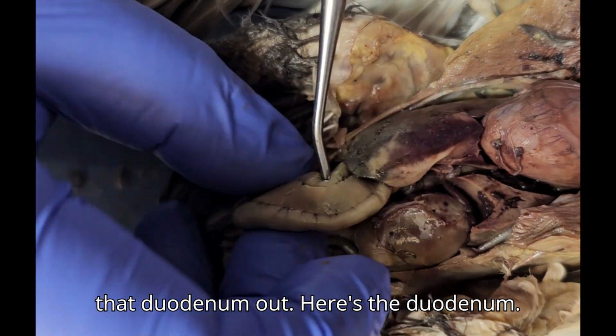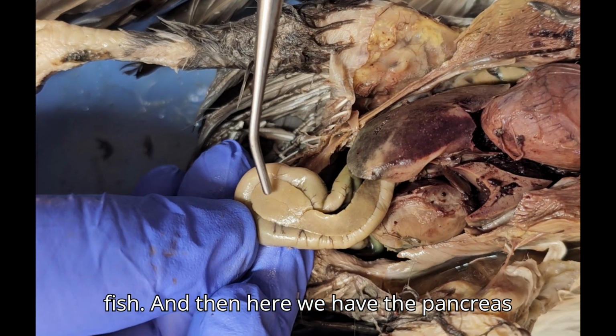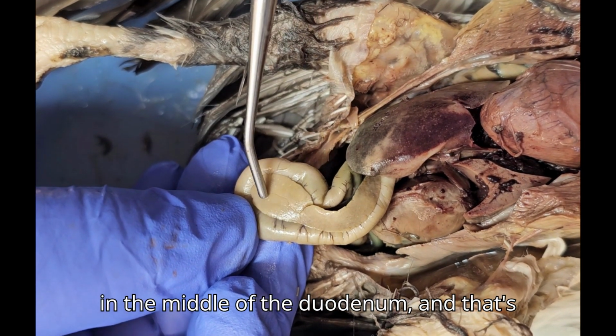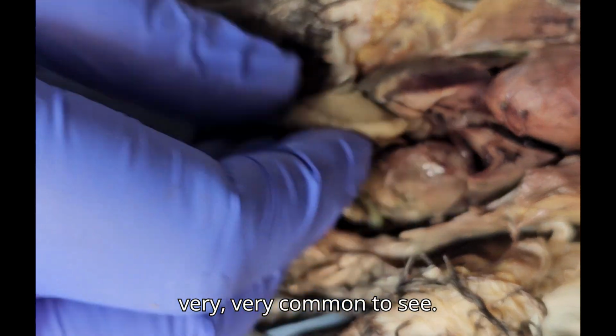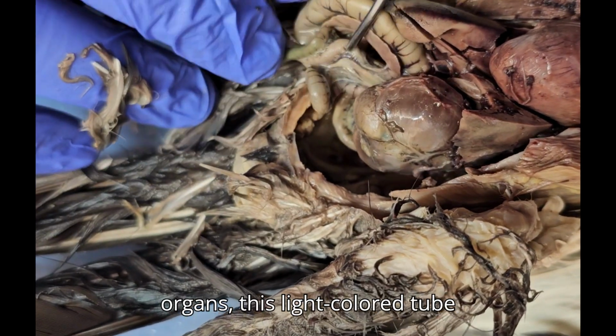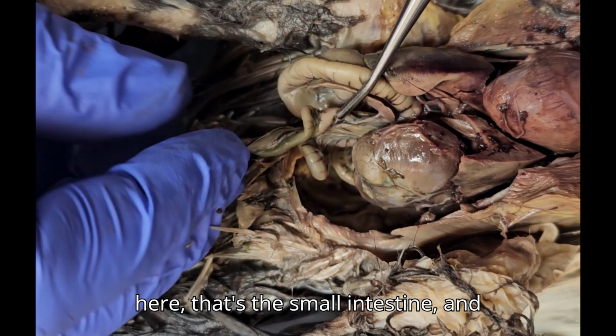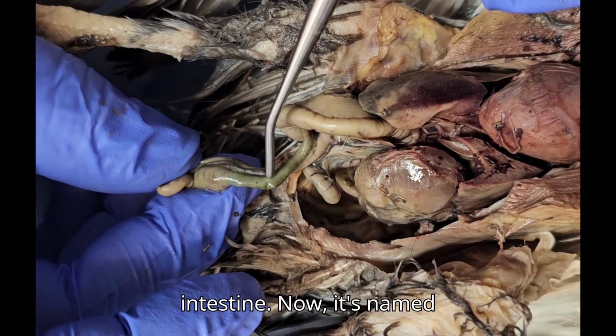Let's pull that duodenum out. Here's the duodenum. It's a loop just like what we saw in the fish. And then here we have the pancreas in the middle of the duodenum, and that's very common to see. Looking at the rest of the visceral organs, this light-colored tube here, that's the small intestine. And then the green one is the large intestine.